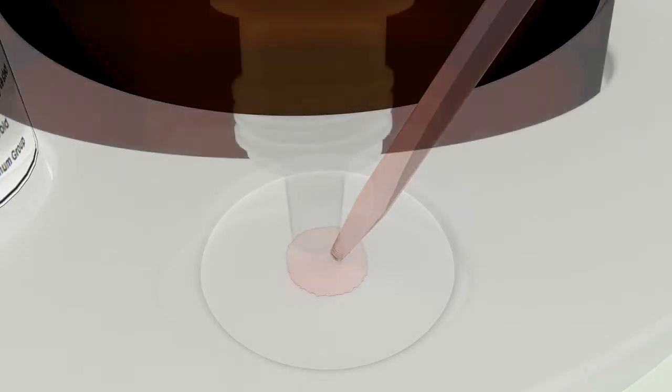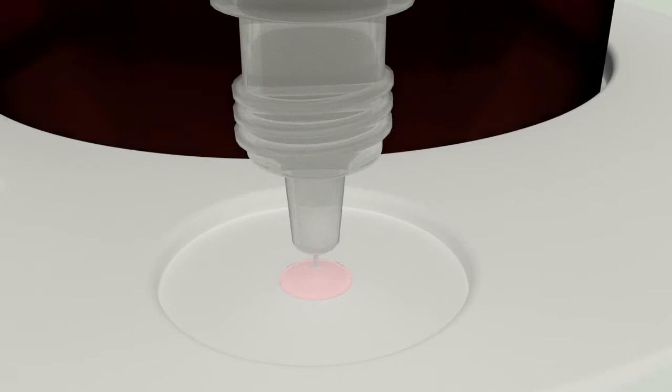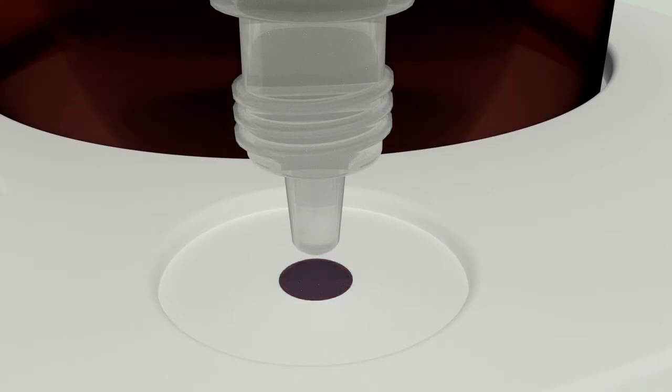Add one or two drops of precious metal test liquid to the sample you just took. If the sample changes color to purple, brown, or black, some gold remains dissolved in solution. In that case, add a little more precipitant and give the gold some more time to precipitate out of solution.